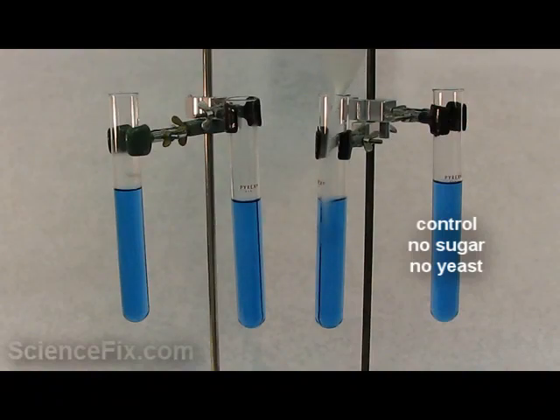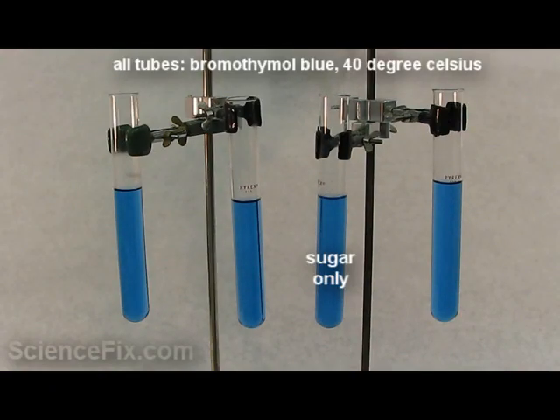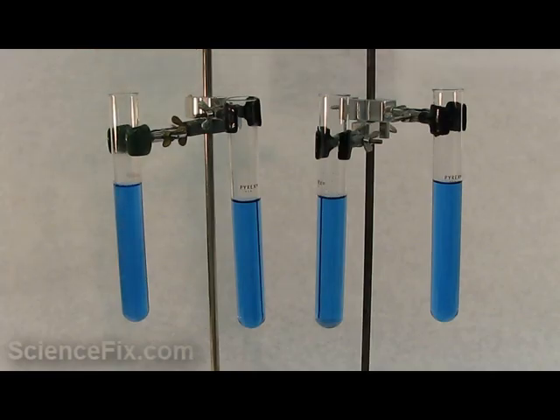This is a demonstration that's supposed to show yeast cells doing cellular respiration and that one of the products of cellular respiration is carbon dioxide. For this test, we have bromothymol blue solution at 40 degrees Celsius.